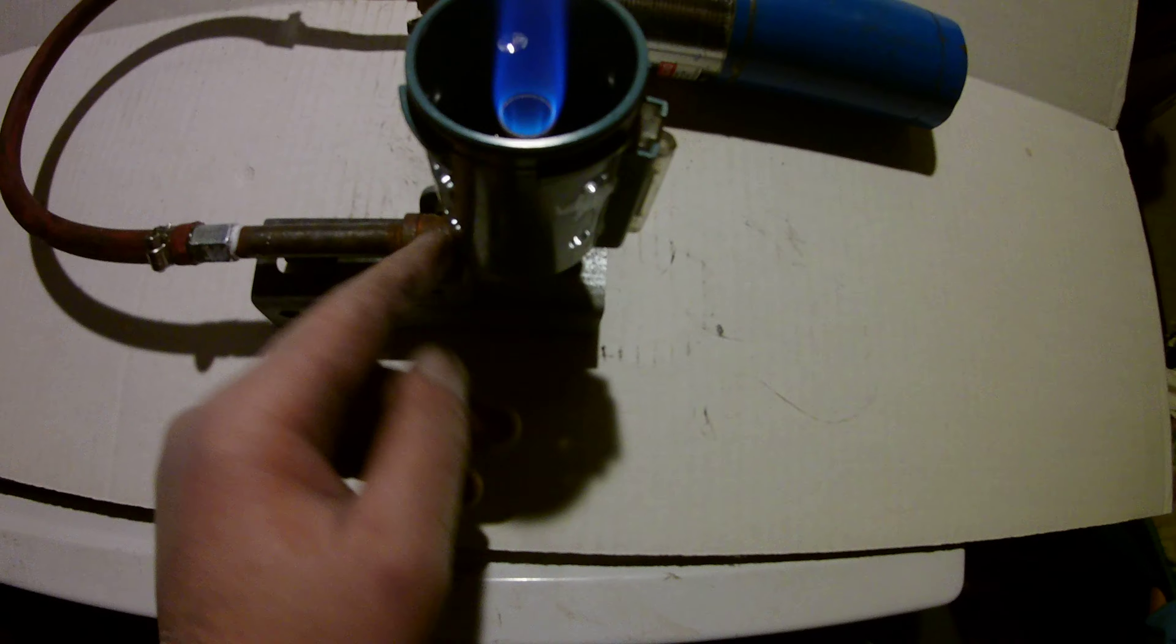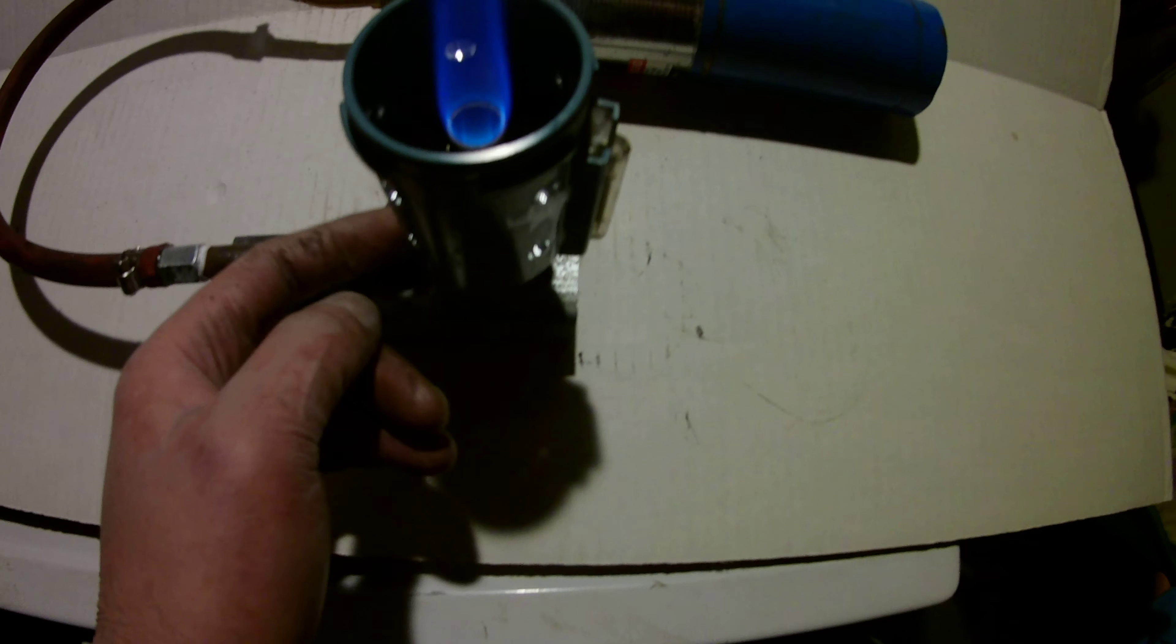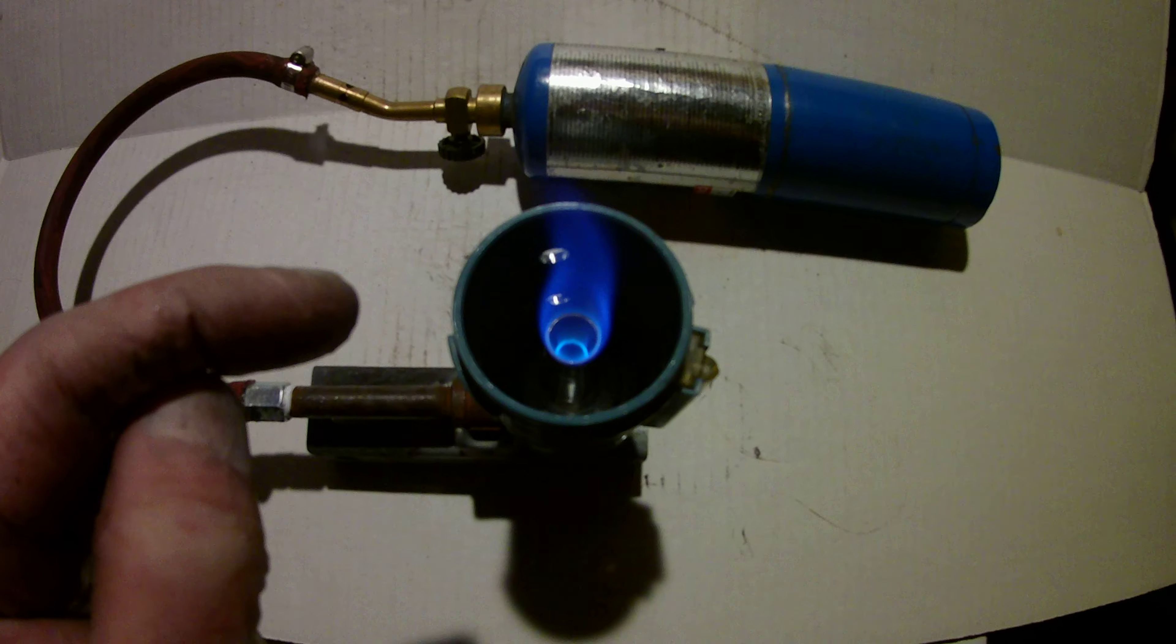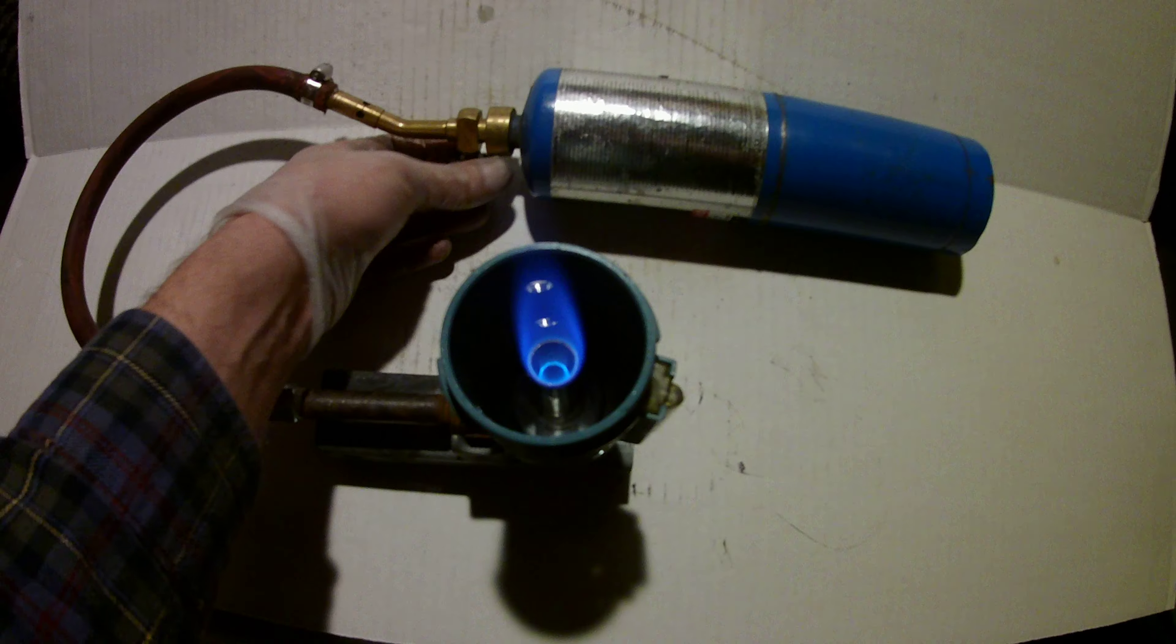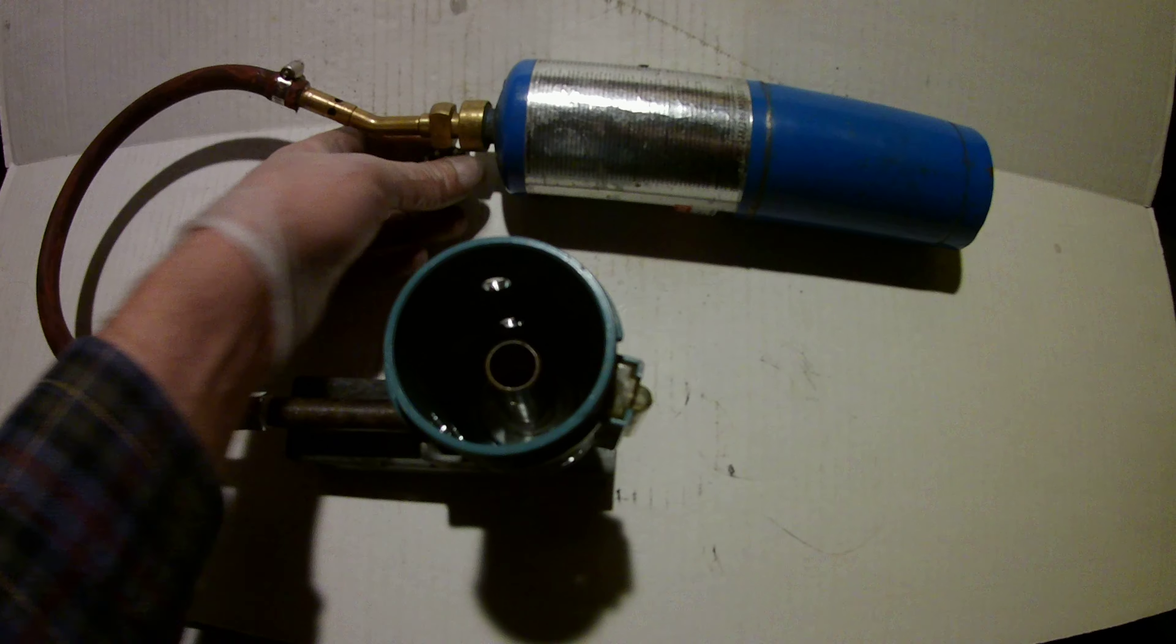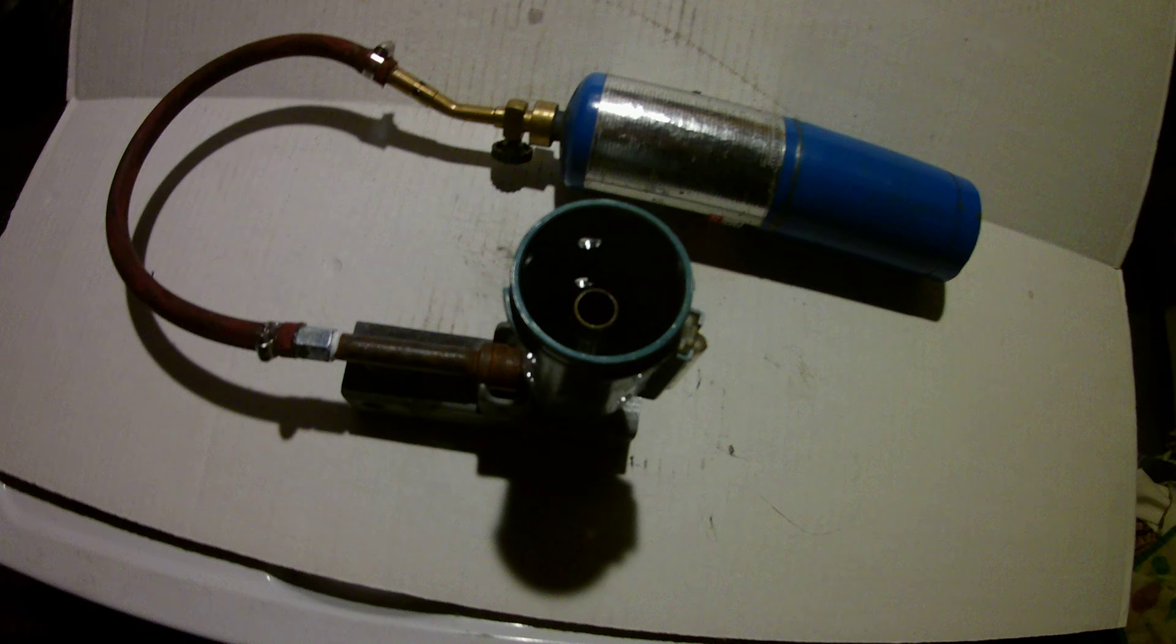That's going to a 90 degree fitting, that's tied in all together with another burner off an old propane torch. Now you can see, there's my control, put it out. Relight it.